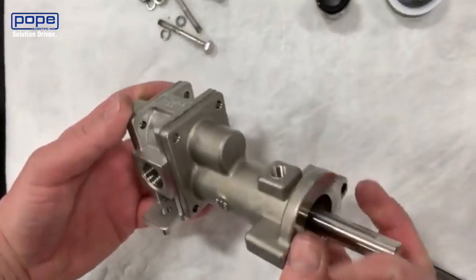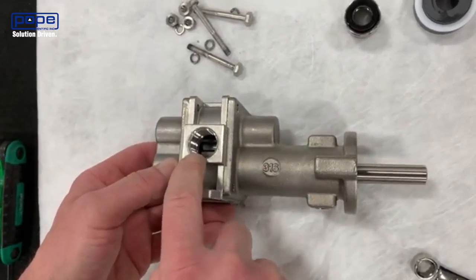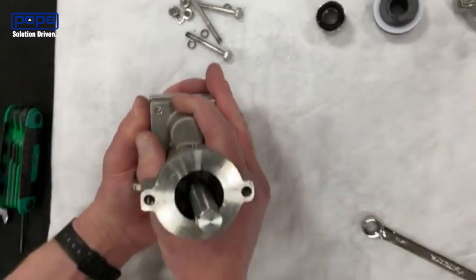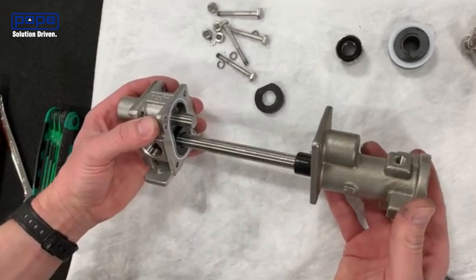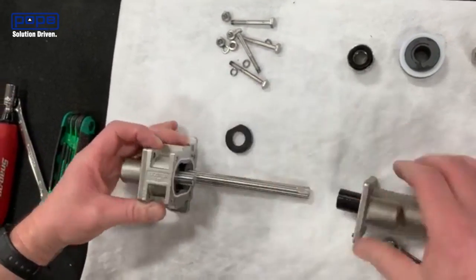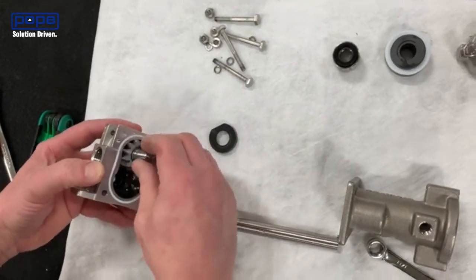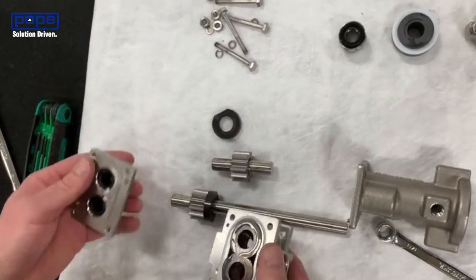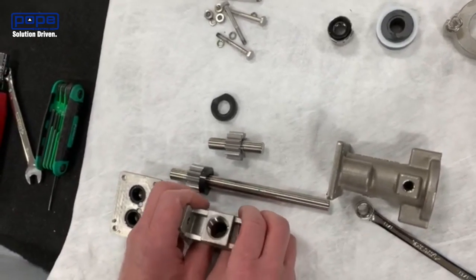We're going to split into three sections: the front housing, center housing, and back housing. So we can just pull the front housing off — be very careful removing that, as some parts might pop out. And there's the gear with the drive shaft, the stationary gear, and now we've got everything apart and you can take the components out.